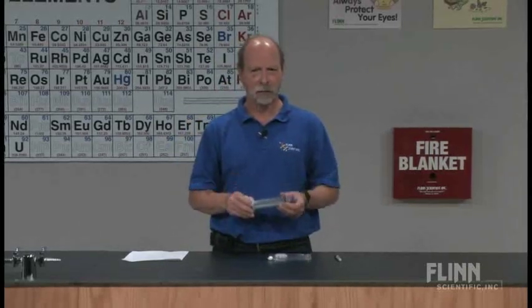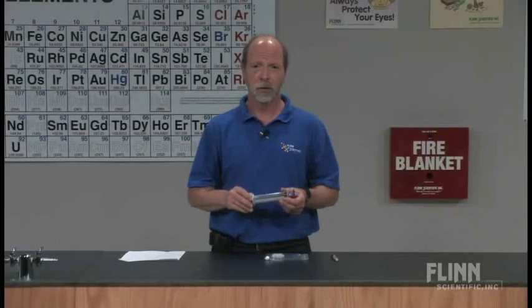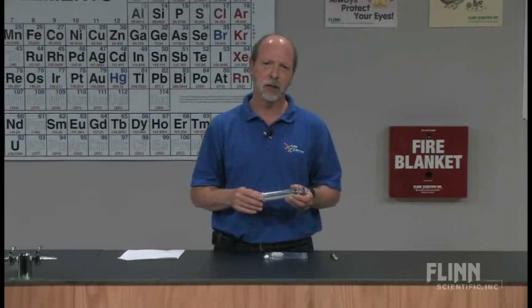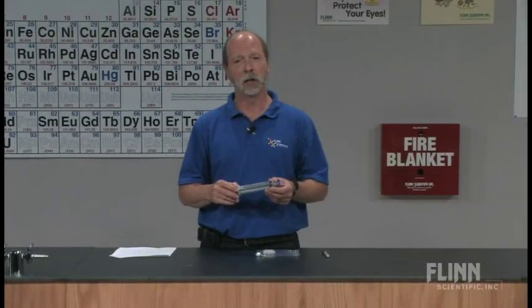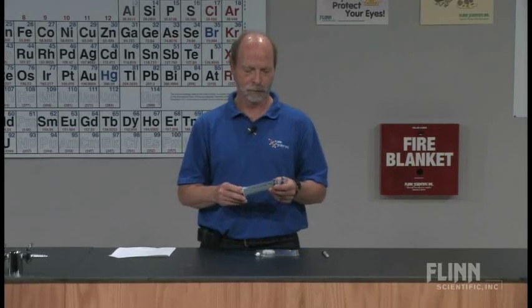One of the precautions: we don't eat food in chemistry lab. So when I do this demonstration, one of the provisions I take is that I take some of the marshmallows from the bag and those we're going to use for experimentation. The rest of the marshmallows I set aside for later on. I tell the students, don't eat the marshmallows I give you now — there will be marshmallows at the end of class if you'd like some.